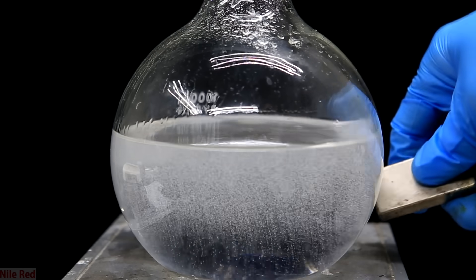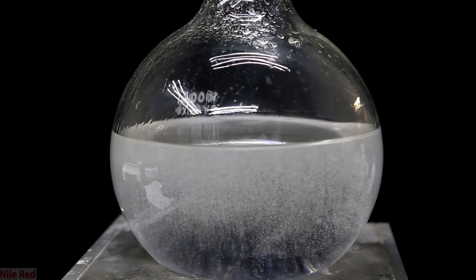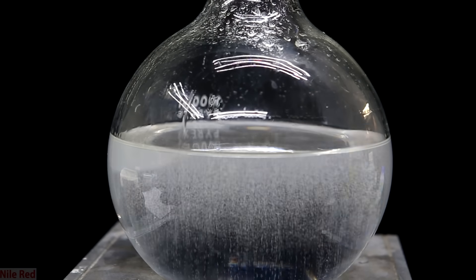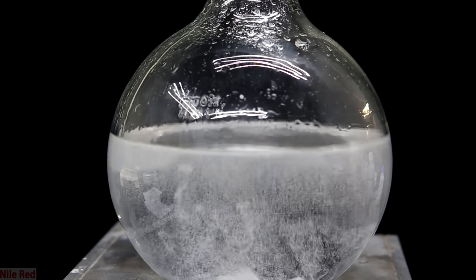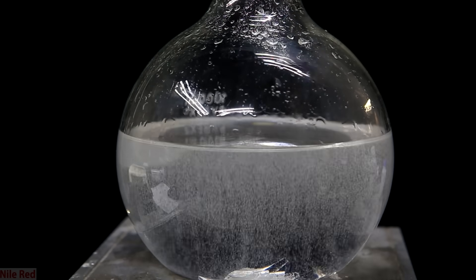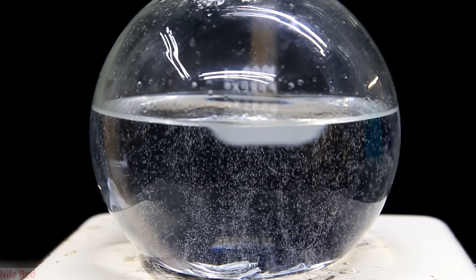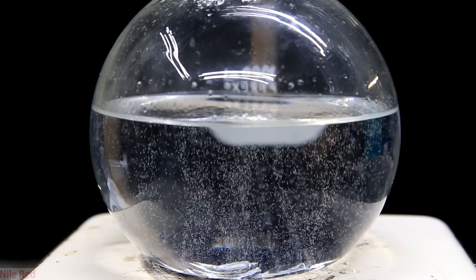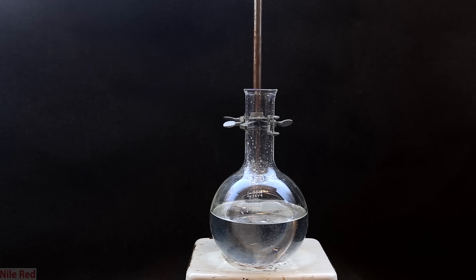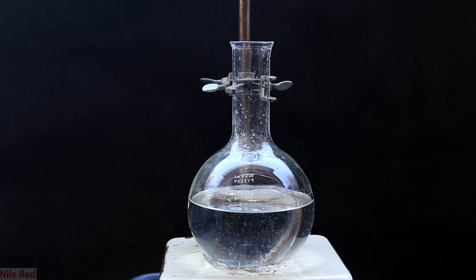The first thing I do is use a magnet to remove the stir bar from the sulfuric acid. We can't use a stir bar because sulfuric acid boils above 300°C and I'm not sure it would survive. Once the stir bar is removed, I start adding the glass to the flask. I added all the glass pieces slowly, but they can pretty much be dumped in all at once. It seemed like a lot of the bubbles were coming off the glass, which made me hopeful they'd work well as boiling stones. The entire setup is then moved outside because boiling sulfuric acid indoors is kind of stupid.